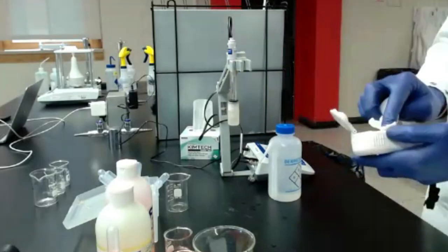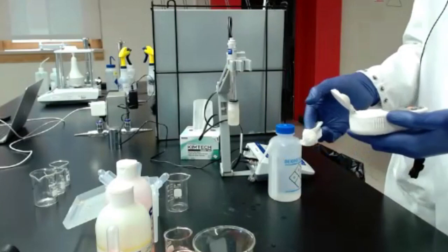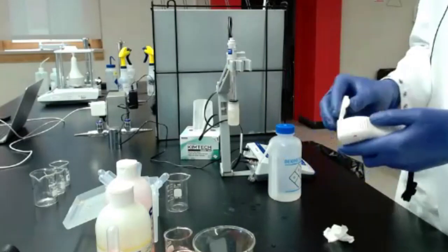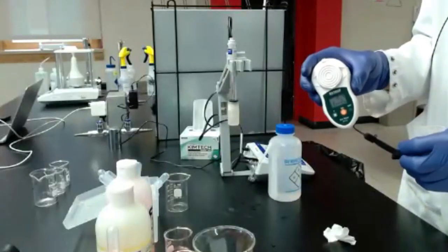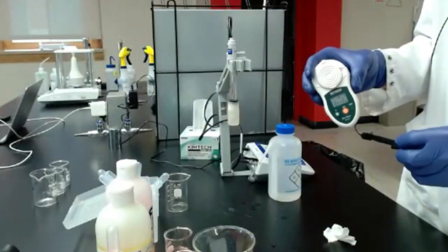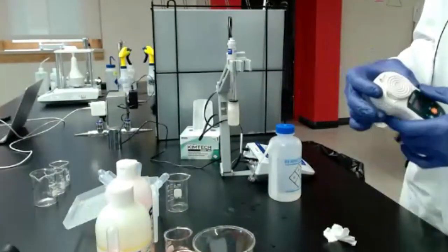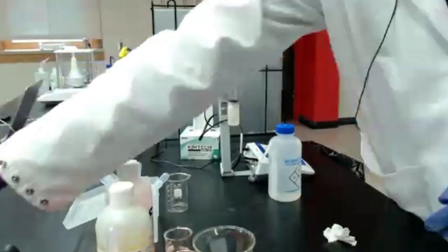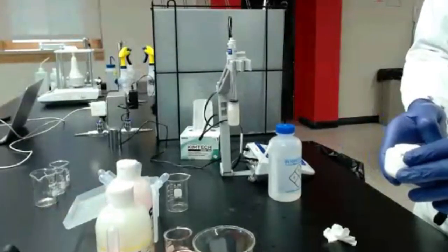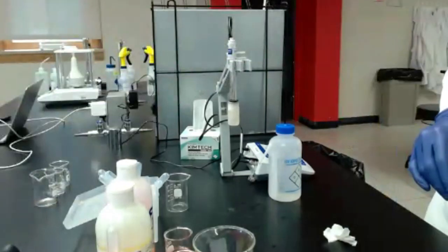All right. So that is total soluble solids. We did it. We measured total soluble solids. We got Brix. Go ahead and do it a couple times. Make sure you get multiple values. And if you did happen to use both instruments, you got different values, we can talk about that a little bit later.